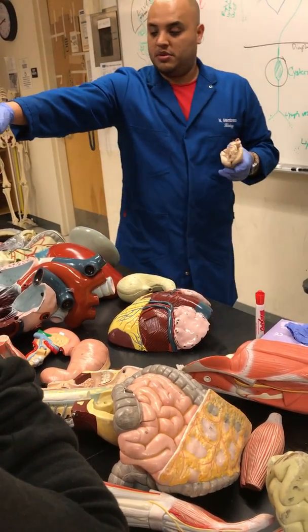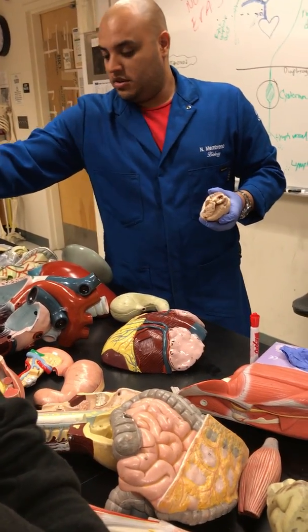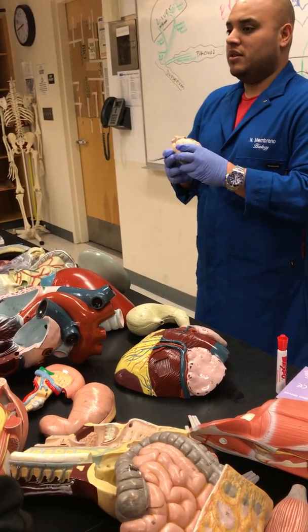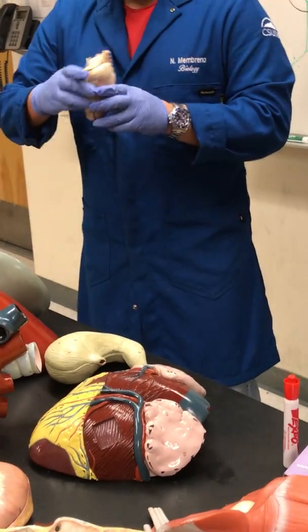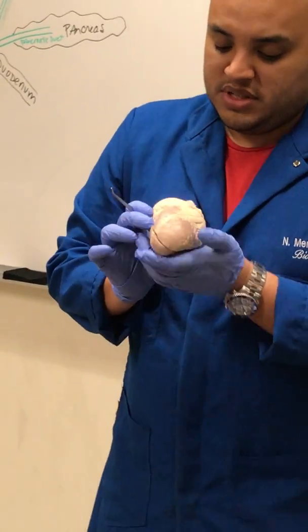Can you pass me a probe? That's on the table. Okay. Do you guys want the large heart or this one? This one's fine, right? Whichever. Okay. So first thing you do, if I put this on the exam, you need to find that it says anterior or posterior, right? So this is posterior. This one is anterior.